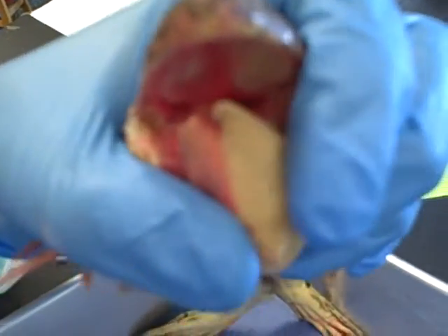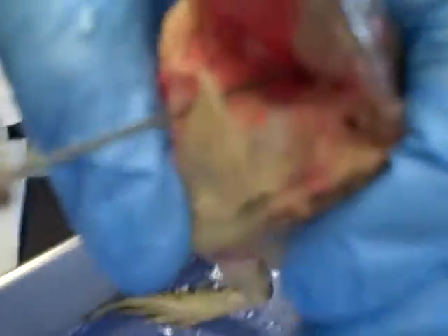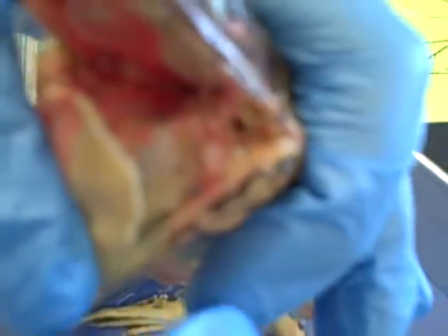Directly behind the tongue, located at a raised surface with a vertical slit, is the glottis. This opening allows air to pass into and out of the trachea. Above the glottis is the opening to the esophagus, which is the larger horizontal opening. The esophagus leads to the stomach.